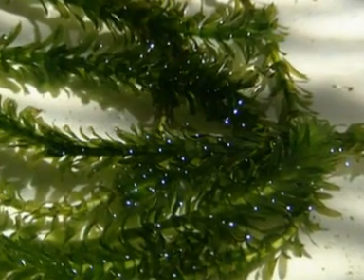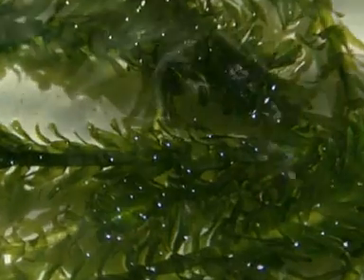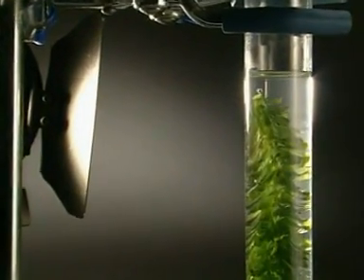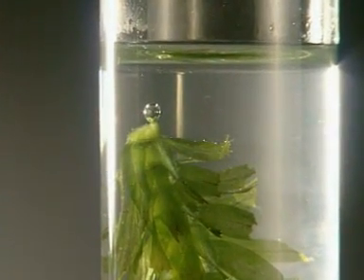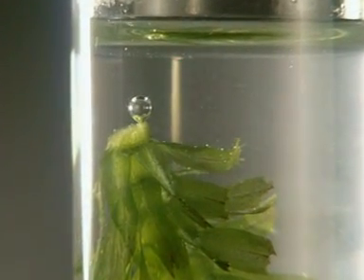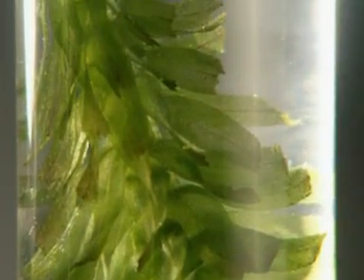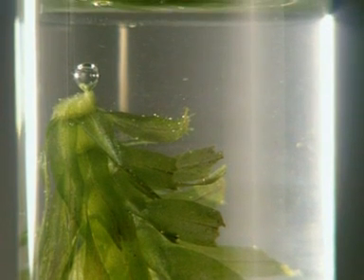A simple way of monitoring the effect of different CO2 levels on photosynthesis is to use a water plant, like Canadian pondweed. As the plant photosynthesises, it produces oxygen, which is released as bubbles into the water. The amount of oxygen produced in a given time is a measure of the rate of photosynthesis.